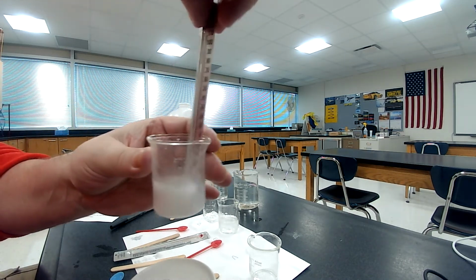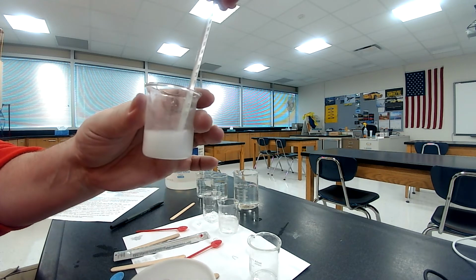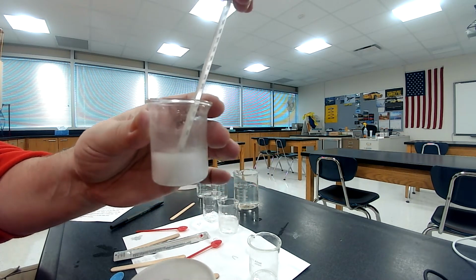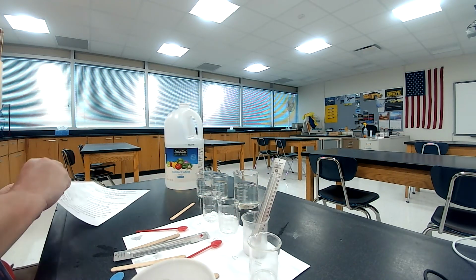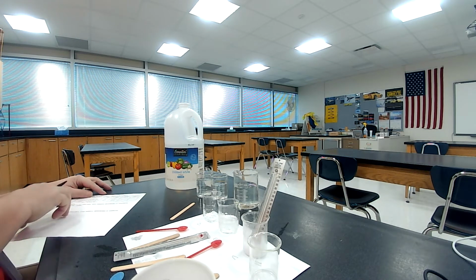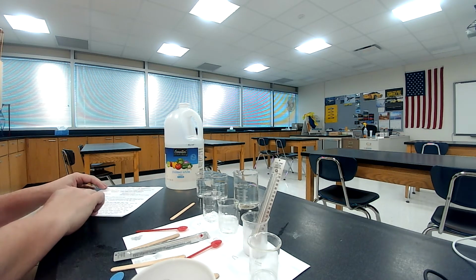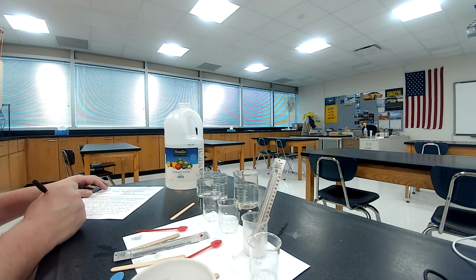Okay. And it looks like the temperature now is 20 degrees Celsius. So now we're supposed to record that as our final temperature in letter C, 20 degrees Celsius. Okay, all right, so number 14 is done now.